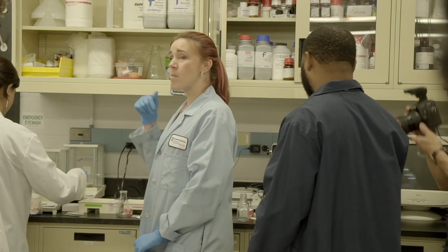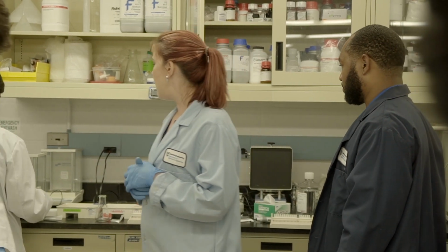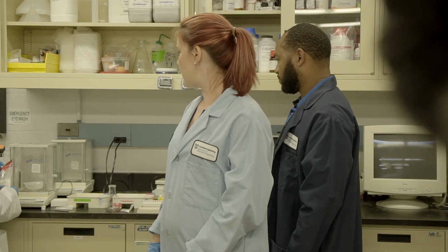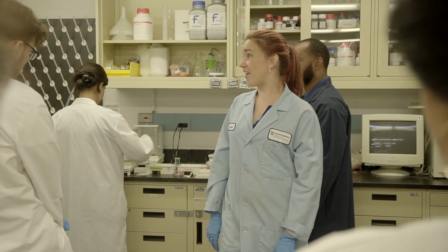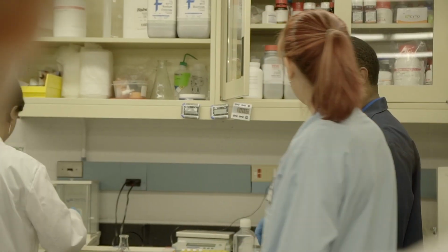It's level, right? Remember we did this last time, so there's a bubble on the back, and he made sure that bubble was in the middle, so he had an accurate measurement. And then once he put his weigh paper or his weigh boat on the balance there, what button did he hit? Yes, tare, right? To zero it out. And then how much agarose are you? We're making a what percentage gel? We're making a 2% agarose gel.